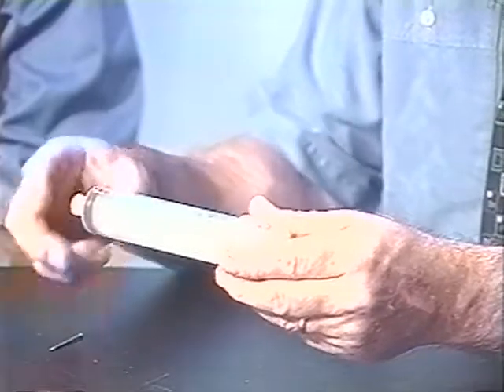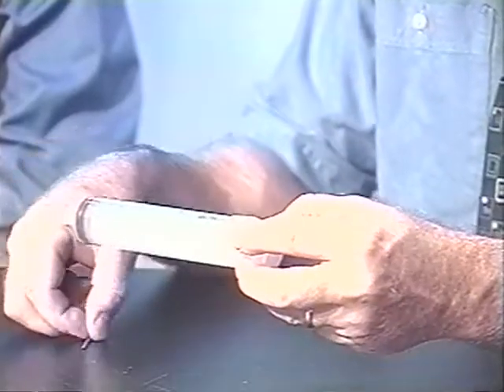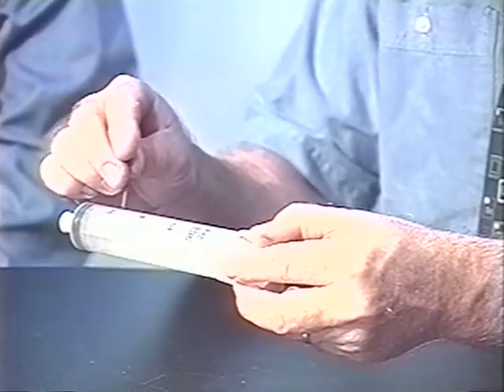In order to measure the mass of a gas that's generated and then determine the molar mass, this syringe is weighed with and without the gas present. In order to weigh it without the gas present, we'll put the latex cap on the syringe and then pull the plunger out while slipping the nail through that little hole.